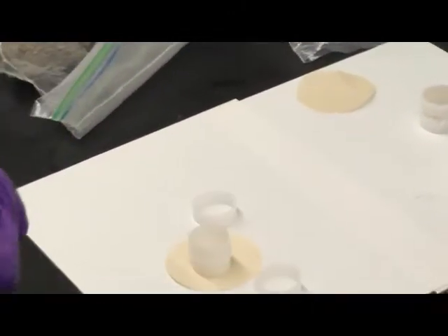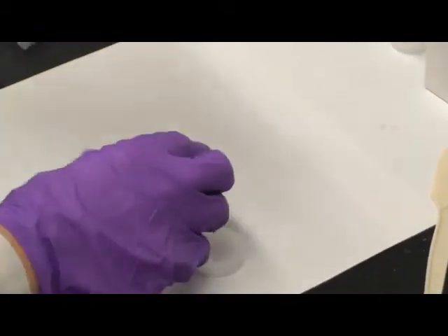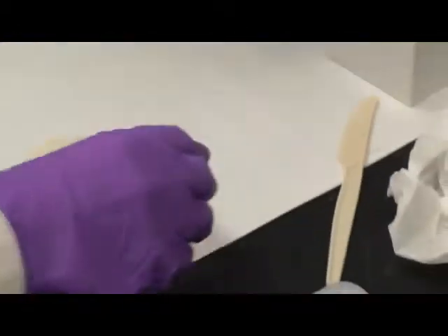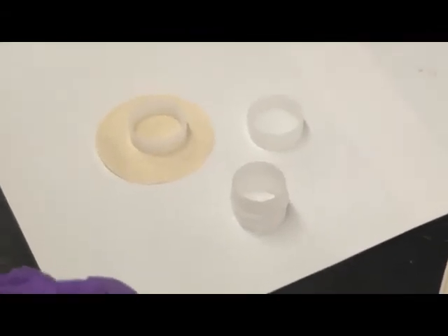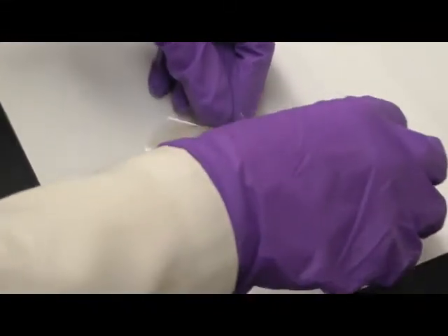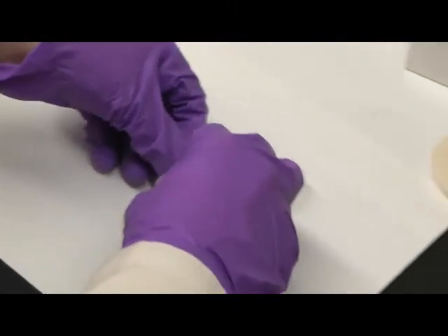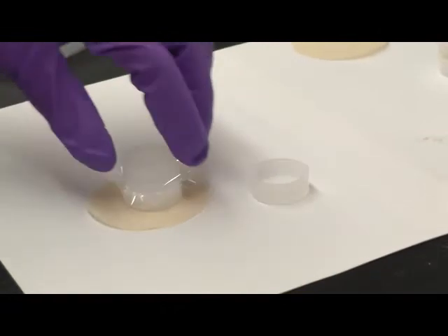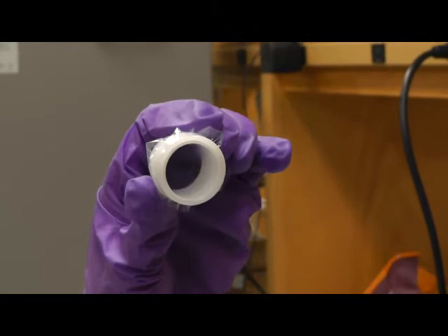The XRF components are basically the same. So we still need three parts: the ring, the middle one, and the cap. First we take one thin film, put on the ring, and then we push the middle part down. And we examine it. The thin film is quite flat, so it's a good one.